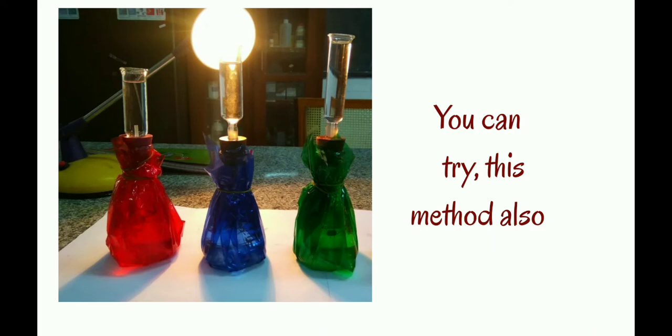You can also try this experiment by simply wrapping the cellophane colored paper to the conical flask.